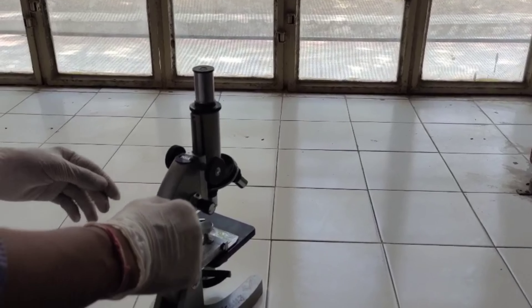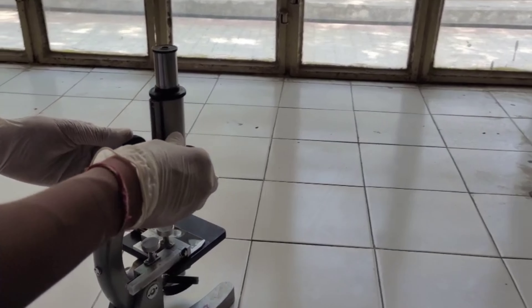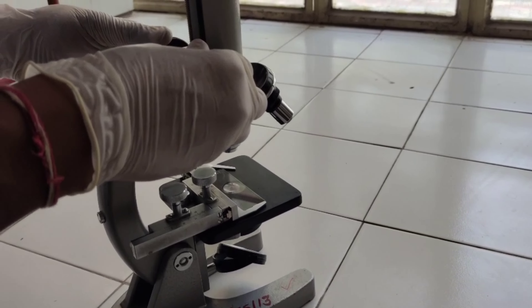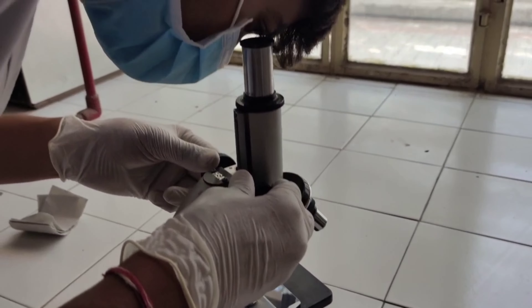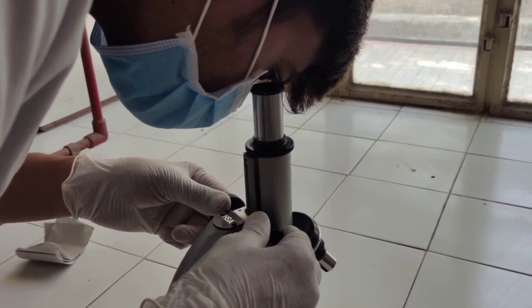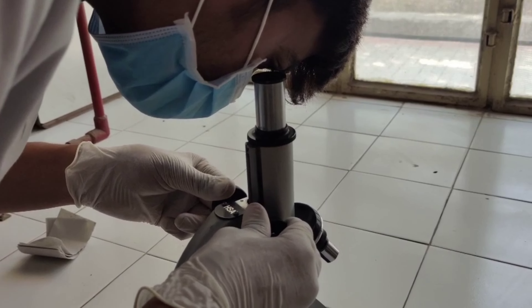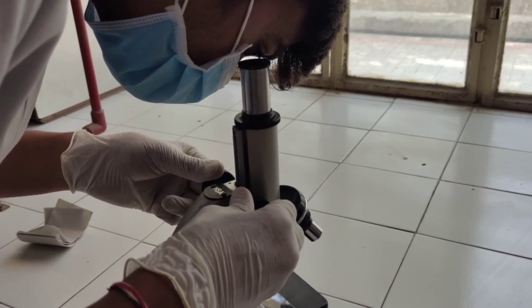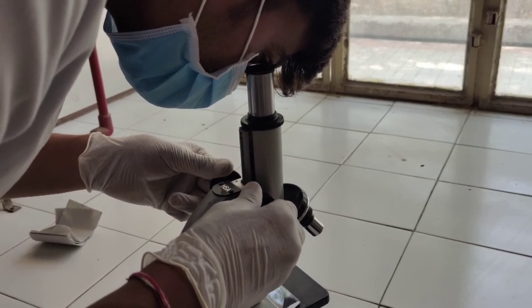After checking the given slide under the microscope, we found out that a purple color was observed on the slide. This indicates that the given bacteria was Gram-positive in nature.